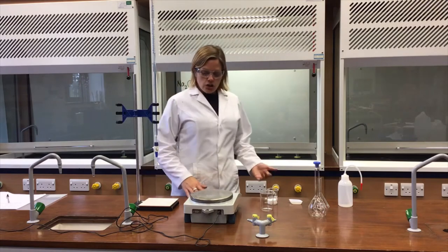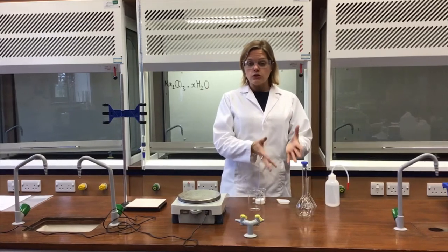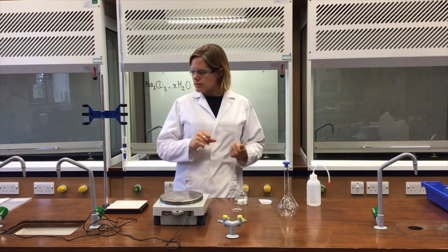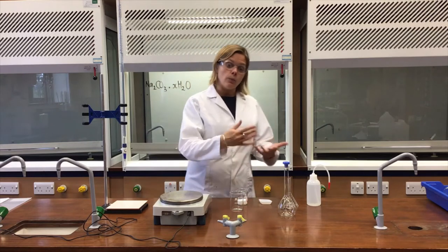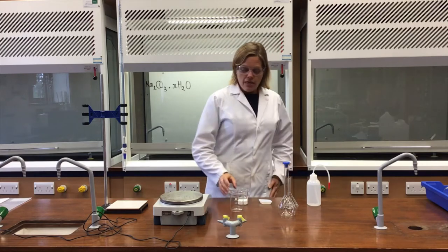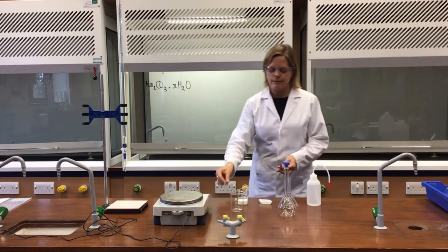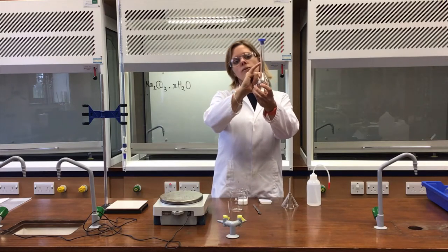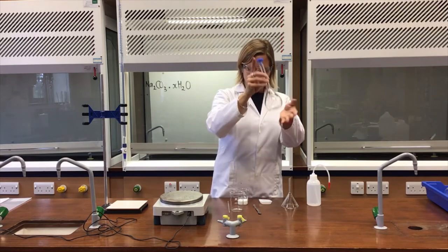To do that, I'm going to use a method for making a standard solution — making a solution carefully with well-known quantities — and then titrate that solution against hydrochloric acid in the burette to calculate the concentration. I can then work backwards to find how many moles of water were in the original sample. The apparatus includes a volumetric flask (also called a graduated flask), which has a single graduation mark, and we work with the bottom of the meniscus on that mark.